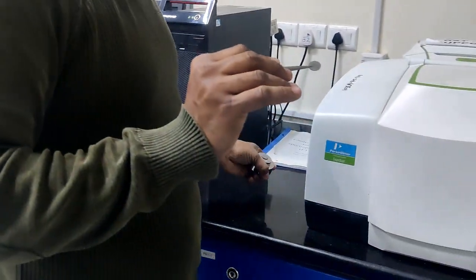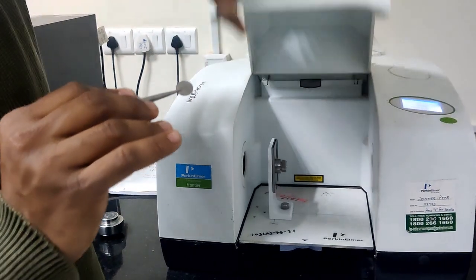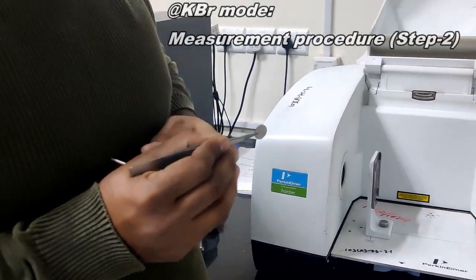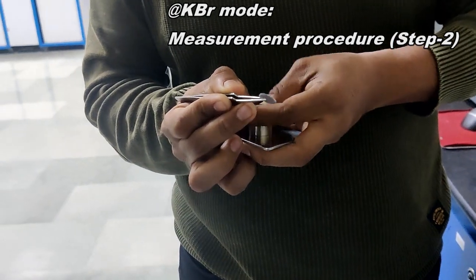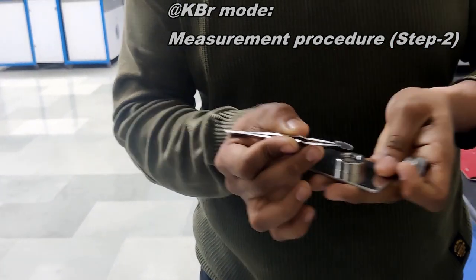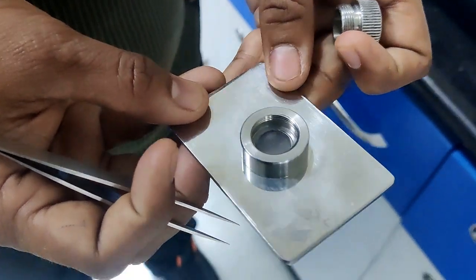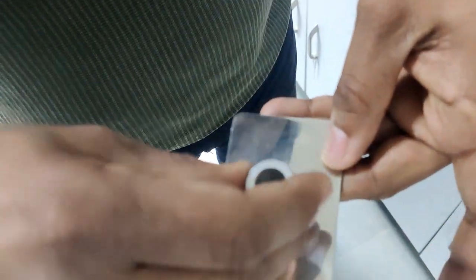After preparing this sample pellet, you have to come to the instrument, open the FTIR instrument cover, and take out the sample pellet holder. So I am just opening this screw. We have to place the pellet inside the sample pellet holder like this. After clipping the pellet inside the holder, I am slowly rotating.